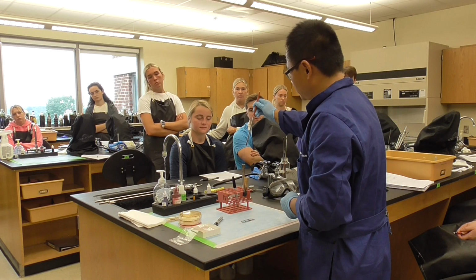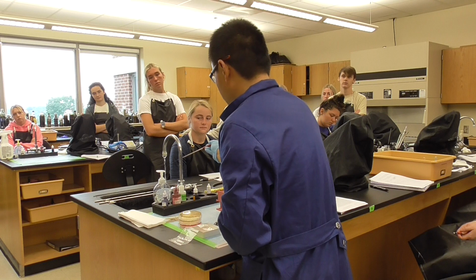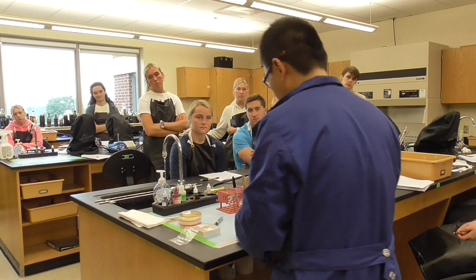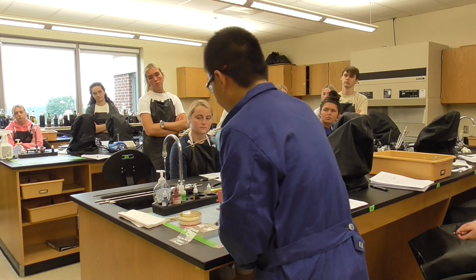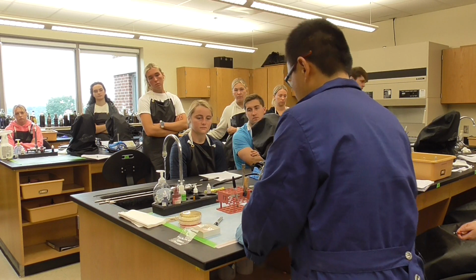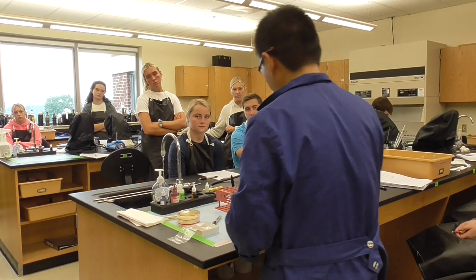So we're going to add water there. Before that, you do the sterilization. Make sure it's pink or red. That means it's burning and killing all the bacteria. Okay, we're going to put 1 drop of water on each circle. And then we sterilize it again.